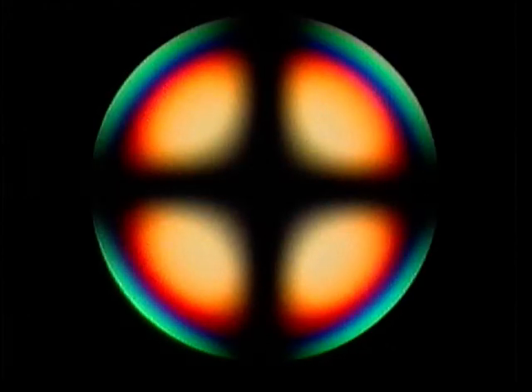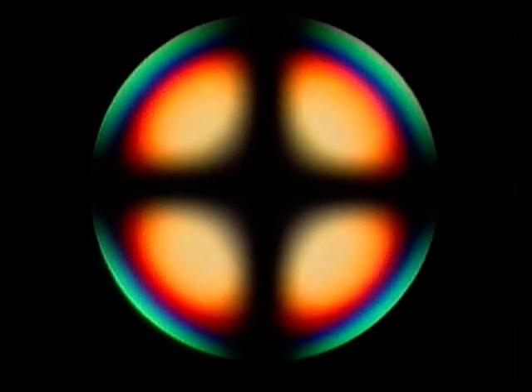Here's another figure for you to try. Plate in, plate out. Plate in again, and you can see when the plate is in, the isogyres go purple and the symmetry is reduced. Concentrate on the northeast quadrant. There's a rise in the northeast quadrant, therefore E' is slow, therefore optically positive.